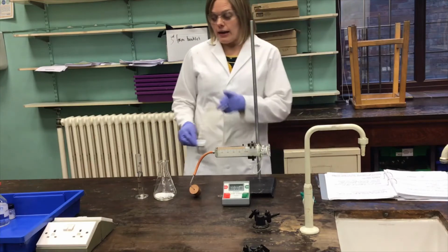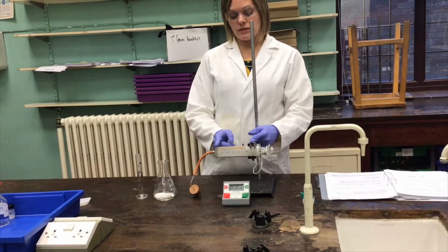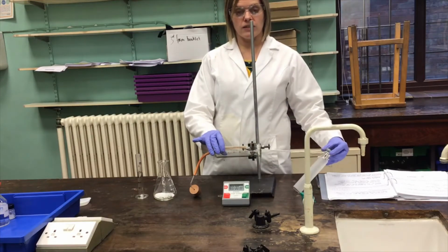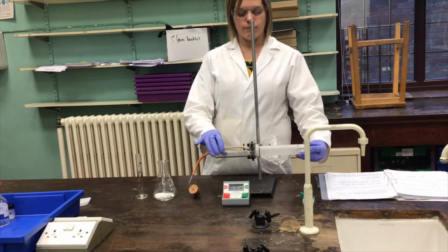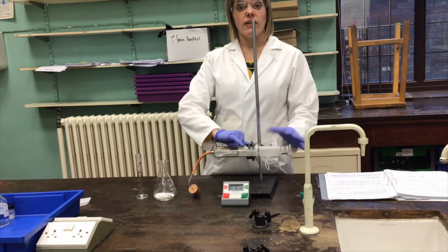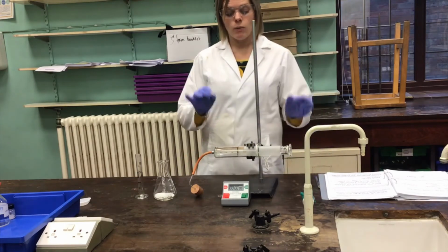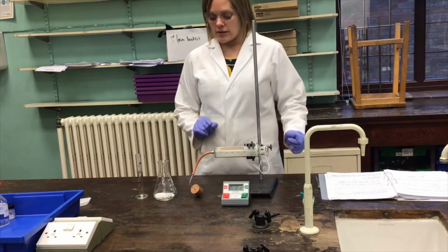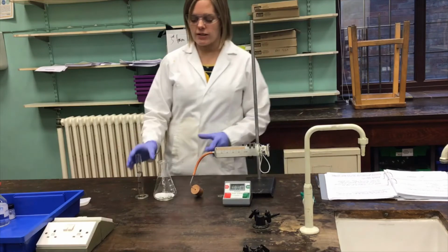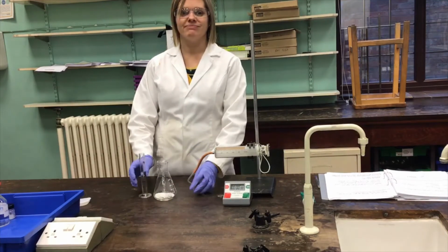Importantly, the gas syringe has a fixed capacity, and if we exceed that capacity, then the barrel comes all the way out and it can fly off and smash or what have you. So if this gets to 100 centimetres cubed, I might as well take the bung out in any case, because I can't measure any more. So if it gets to 100, we'll stop the experiment. All right, here goes then. So let's just get zoomed in nicely so that I'm ready to pour this in, put the bung on and get started.